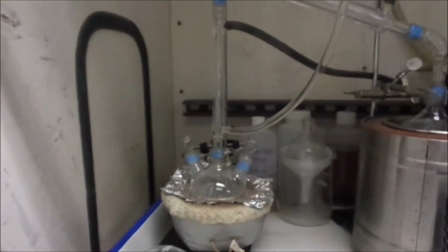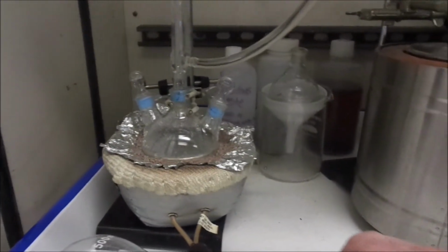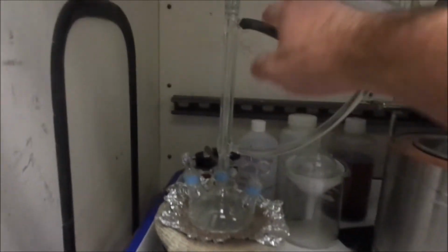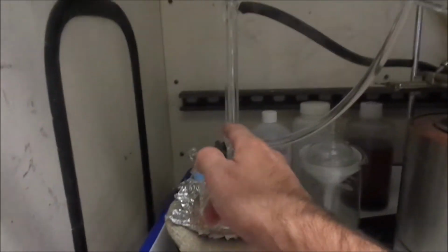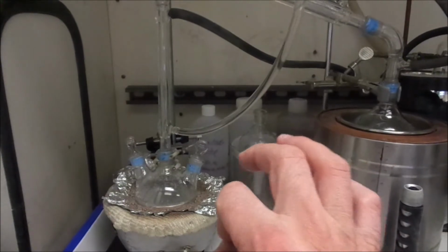It's been running for a while now, and I got the variac turned up all the way. That's as high as that thing's going to go. So that heating mantle is as hot as it's going to get. Yeah, we just won't be able to run water through it. So what we'll do instead is pull this tube back off, hook it back up the way it was, drain the water out of the column, and then we'll just do it real slow.